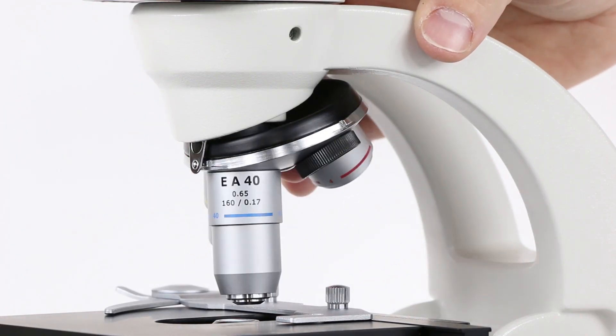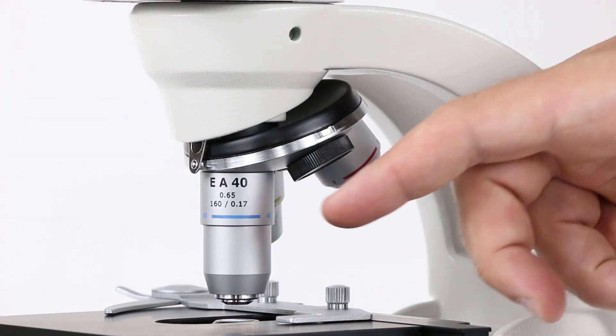And turn it to the third lens here, that is the high power lens that has a magnification of 40x.